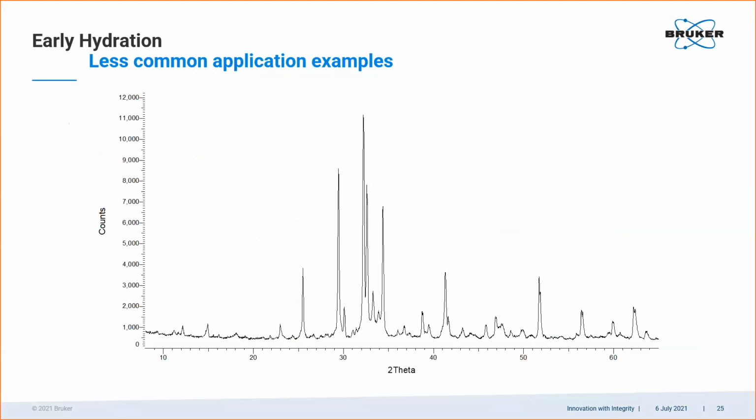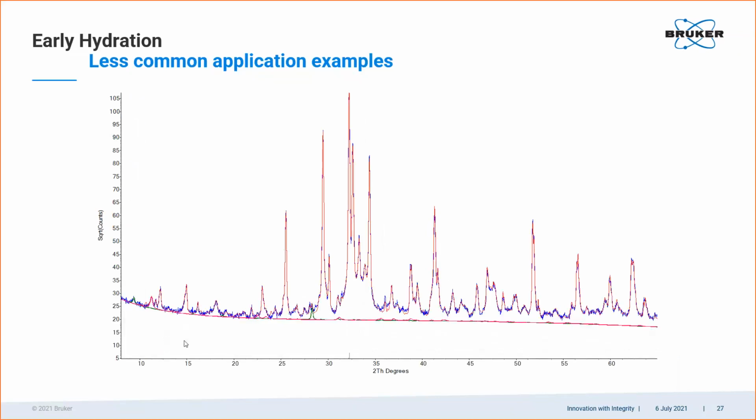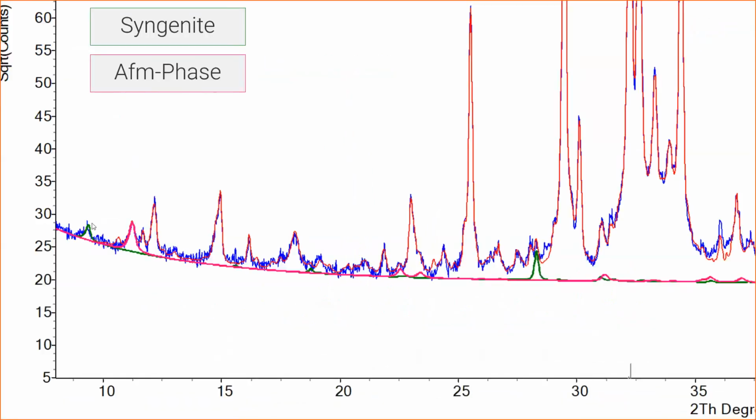So this is a raw data set of an aged VDZ 100 sample. And I would like to draw your attention again to the lower part of the scan, looking at the range from 8 to about 12 degrees. What we see here is, maybe if you watched the presentation carefully, you will recognize syngenite, but here's something else, another peak. On the left side, this is syngenite, and this is a calcium aluminate hydrate phase, the so-called AFm group.